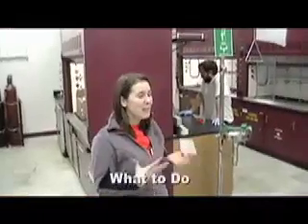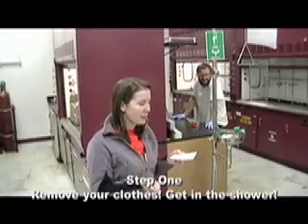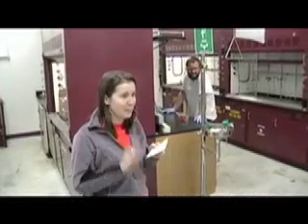Hey, Chase, I had a spill. So step one, you should remove your clothes as fast as possible and get under the shower. And when you're under the shower, don't rub, just rinse. You don't want to rub anything in. And stay under the shower for 15 minutes.